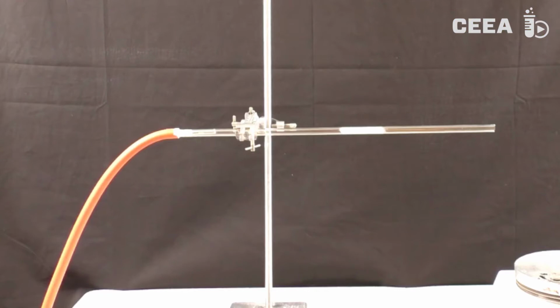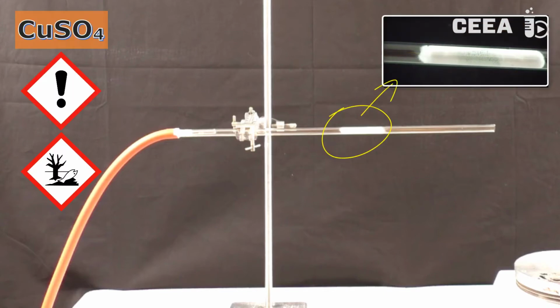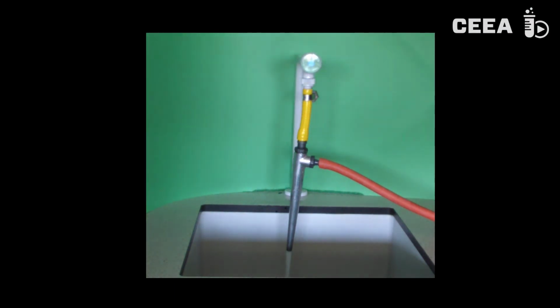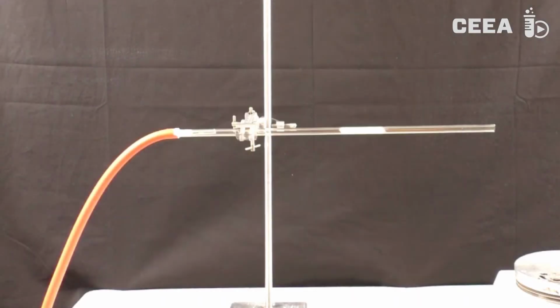We will now use white copper sulphate to detect water in an airflow. In a horizontal glass tube, a bit of copper sulphate is locked up between small pieces of cotton wool. An airflow is let through the tube with help of a water jet pump that is connected with the red hose to the left end of the glass tube. In the beginning, dry air is passed through the tube and the copper sulphate thereby remains white.